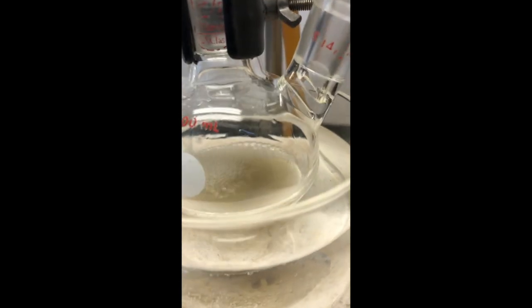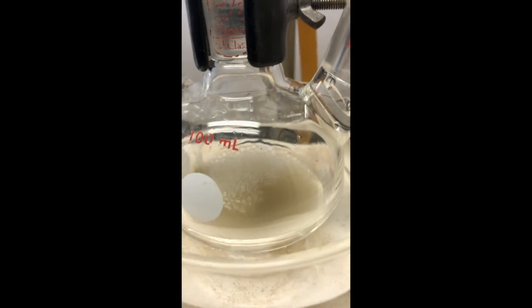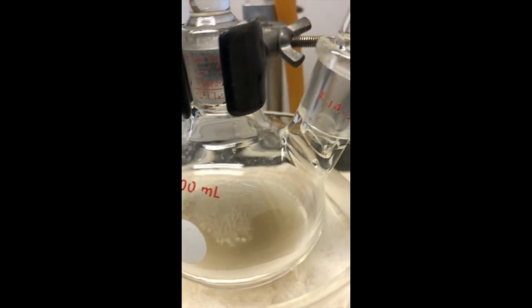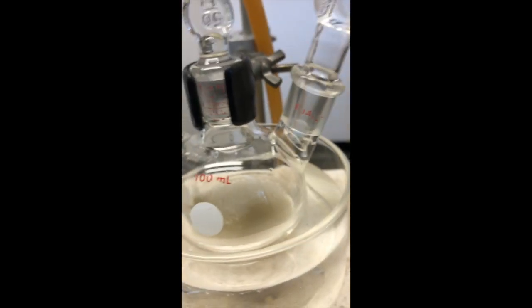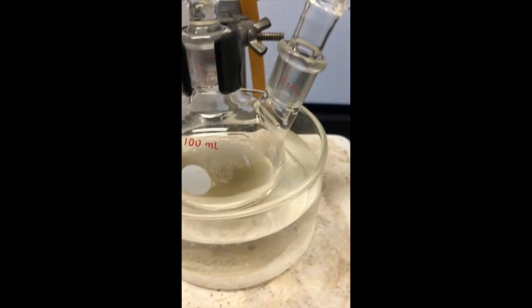Notice the solution has now started to make a cloudy precipitate. And we've got much more rapid condensation off of our condenser. Make sure the stir bar is going.